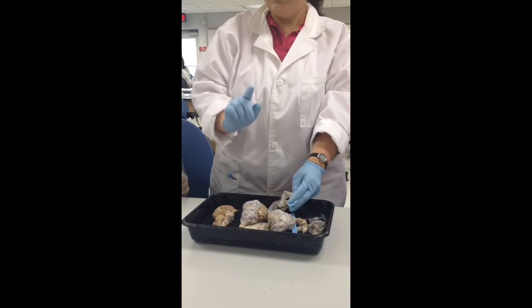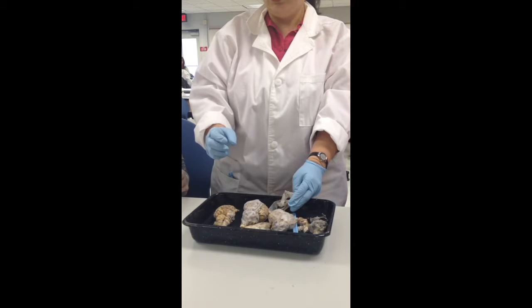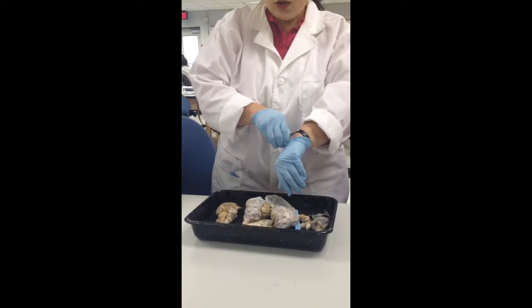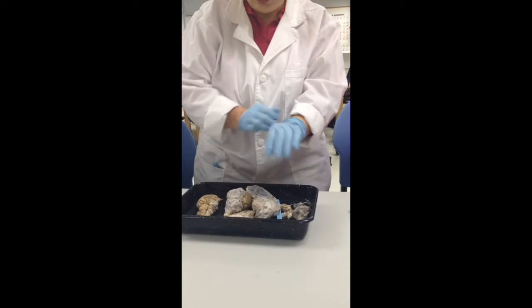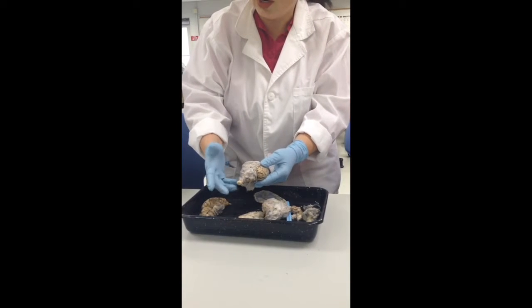Starts with an S. It's big venous blood and CSF draining through. It's a sinus, right? A sinus. Okay. So the sinuses are going through here and exiting out and draining the CSF.